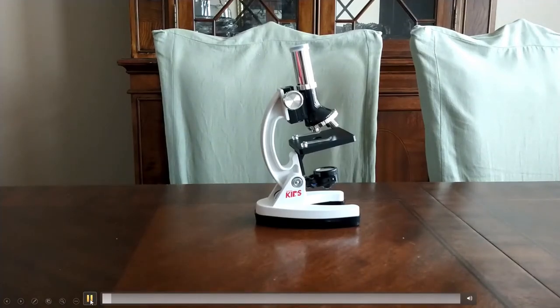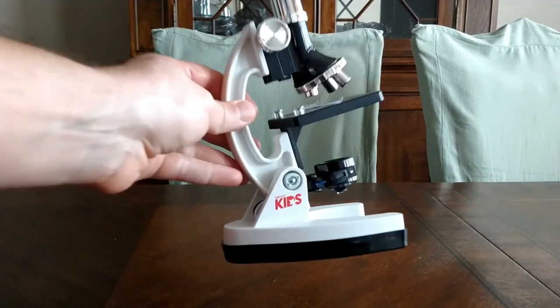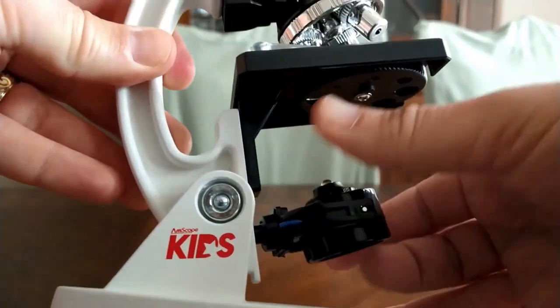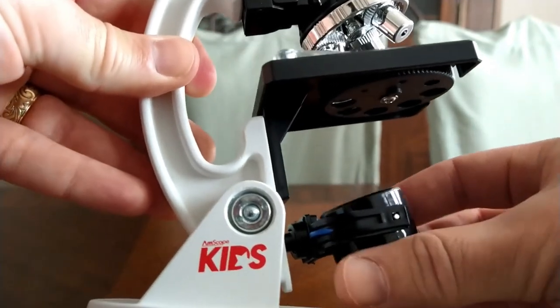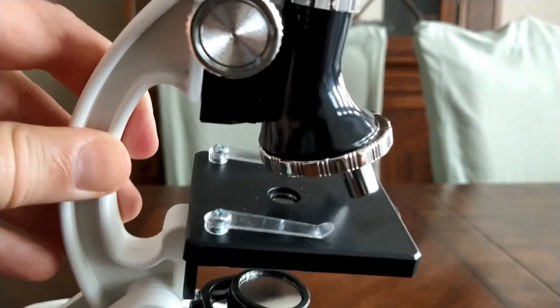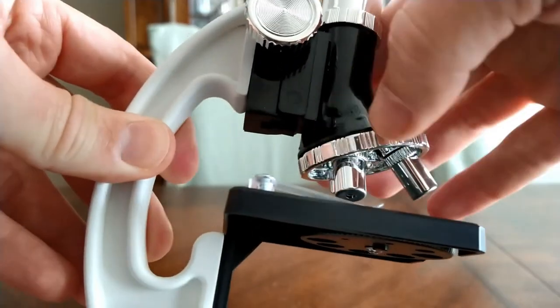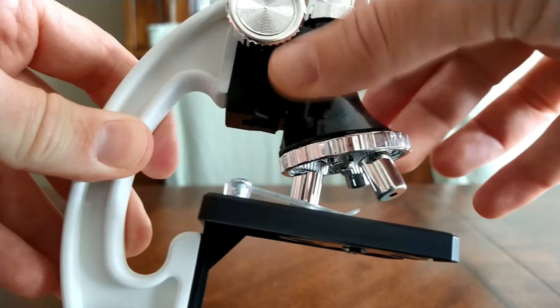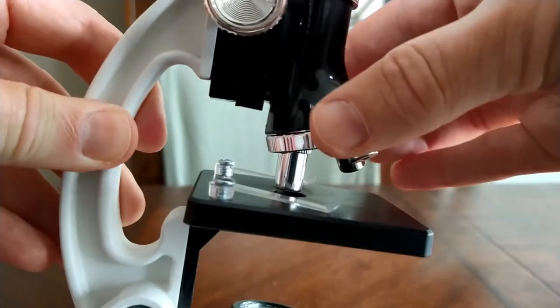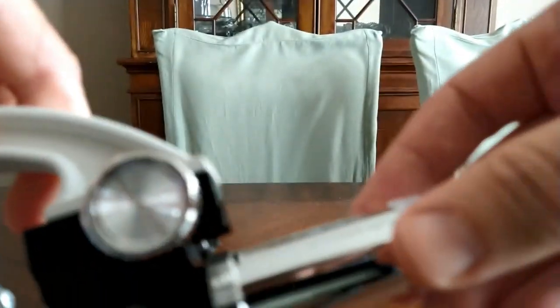Hello everybody. Today I'm going to come to you with yet another question. I'm going to ask: how is a small biological microscope, like the one I'm holding in my hands here, similar to a transmission electron microscope, which utilizes a very powerful electron beam to look at specimens? Think about it a little bit and watch the next lecture.